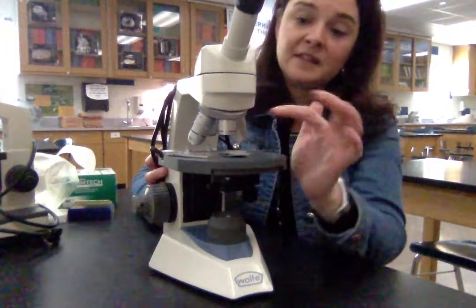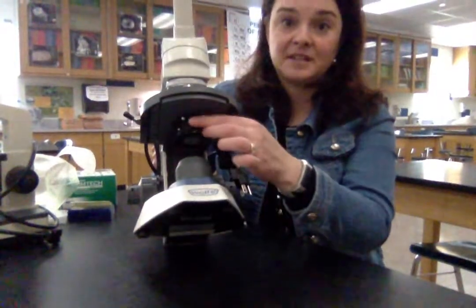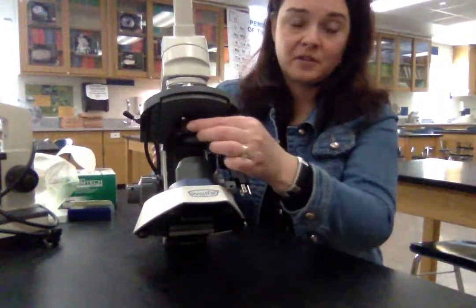If I were starting to look at this leaf cross-section and wanted to find the leaf, the first thing I would do is see what's on the slide and center it over the hole in the stage. We want to make sure the light source is on, and underneath the stage is the diaphragm — on the new ones it has a little lever that lets in different amounts of light. In most cases we want the maximum amount of light, but you can adjust it; sometimes it's easier to see bacteria if the light is a little lower.